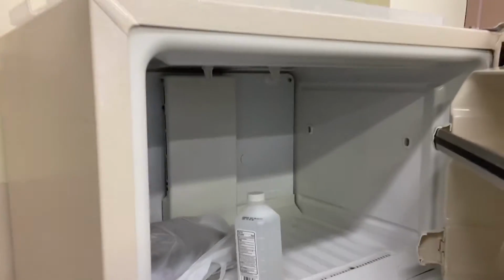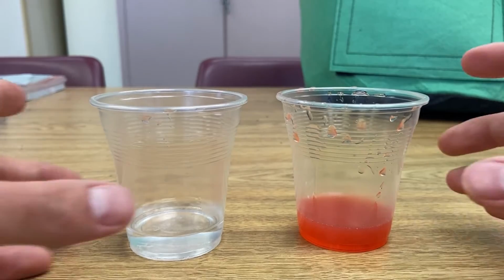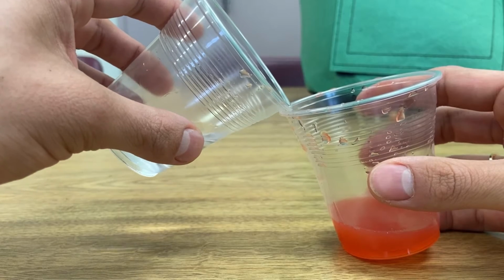So now, let's go all the way to the freezer. Grab our isopropyl rubbing alcohol. Come all the way back. And we're gonna measure out an amount that is the exact same height as that liquid. So now we will slowly pour the alcohol down the side of this cup, and we're not going to stir or mix or blend or anything.